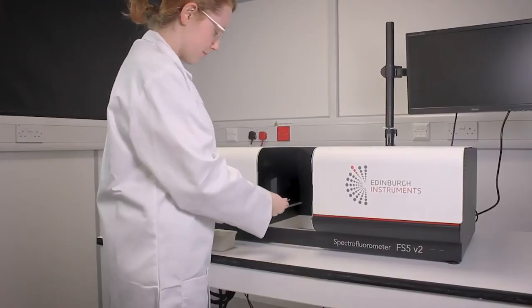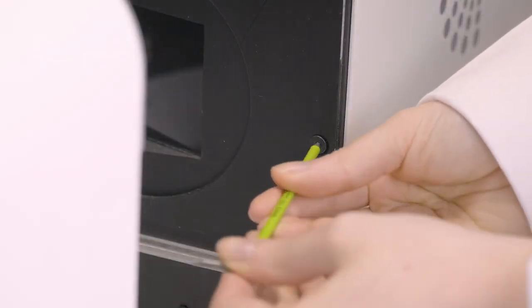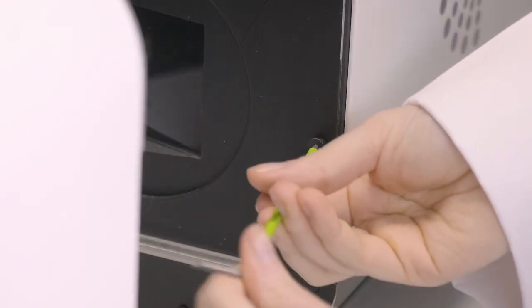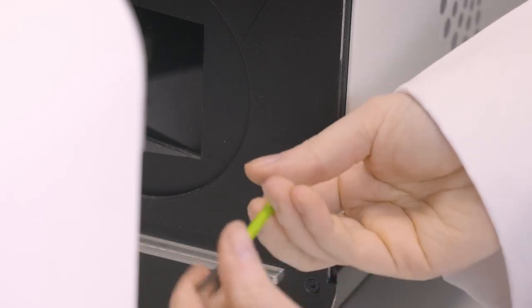Next, remove the black screws located inside the area where the cassette was. There is 1 screw on the left and 1 screw on the right.